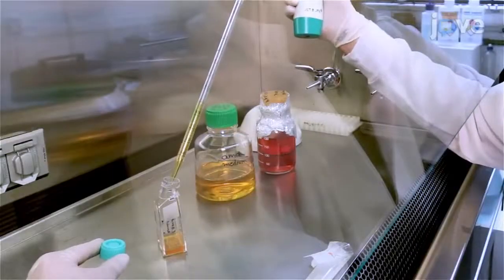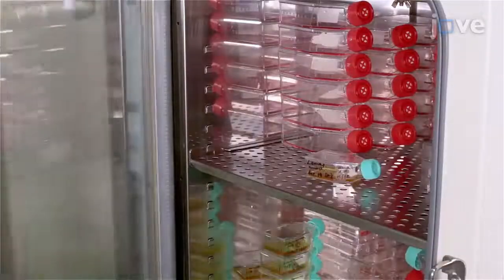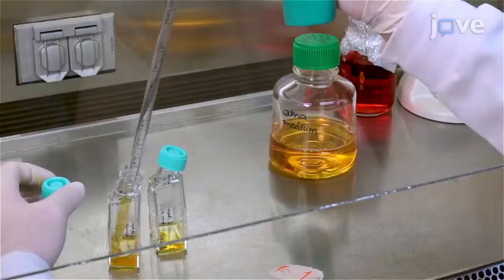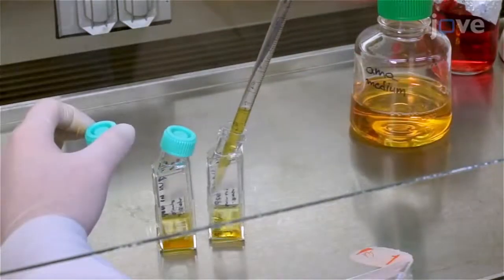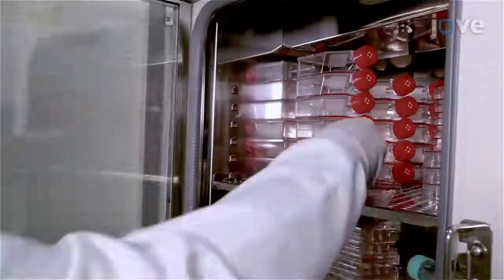Add 5 ml of AMA medium to the flask and incubate it at 34 degrees Celsius for 3 to 4 days. Split the culture by diluting it at a ratio of 1:3 with fresh AMA medium in a new flask. Then incubate it for another 3 to 5 days.